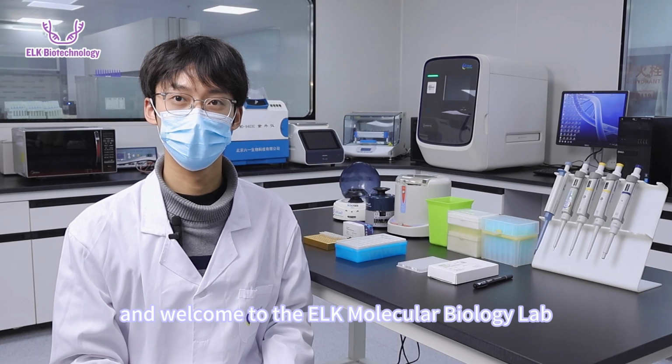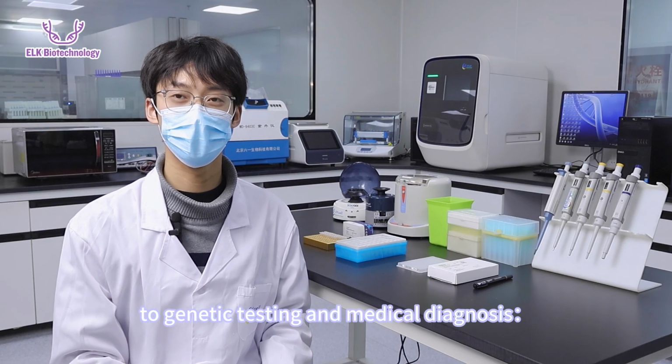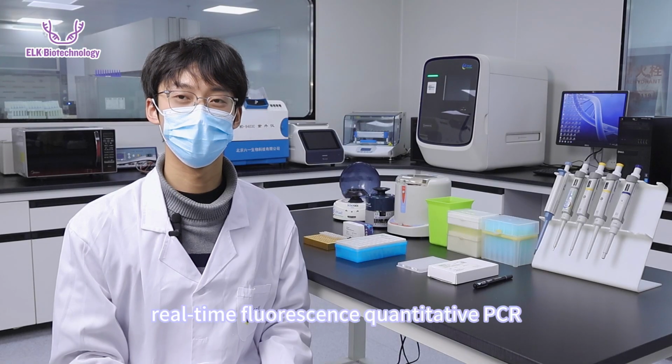Welcome to the ELK Molecular Biology Lab. Today, we will be working together on a technique crucial to genetic testing and medical diagnosis: real-time fluorescence quantitative PCR.